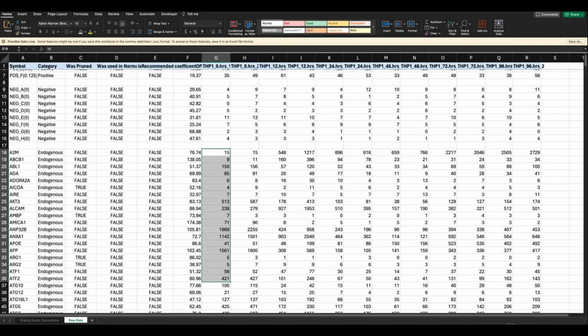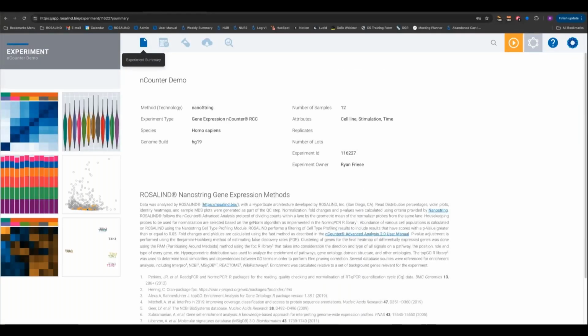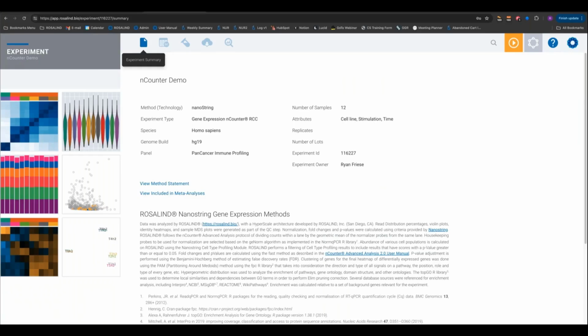So the first one was, what if your experiment doesn't have the positive control scaling factor? If this is a question about having it within Rosalind, it's most likely that this was an older data set. This new positive control scaling factor was a pretty recent addition to the platform. So if you don't have it in your analysis in Rosalind, you simply need to re-upload your RCC files and regenerate the analysis.